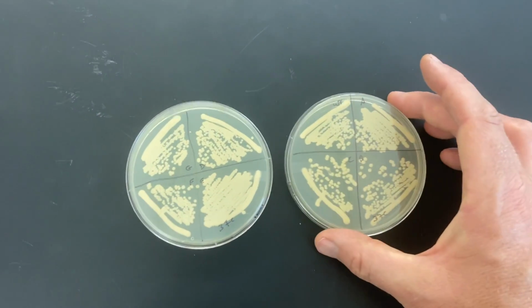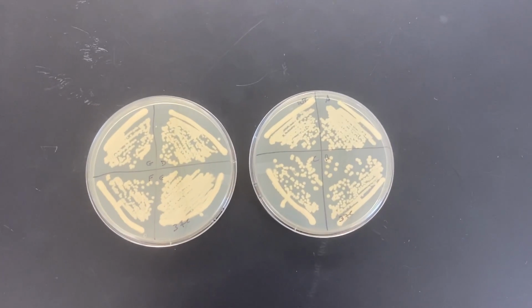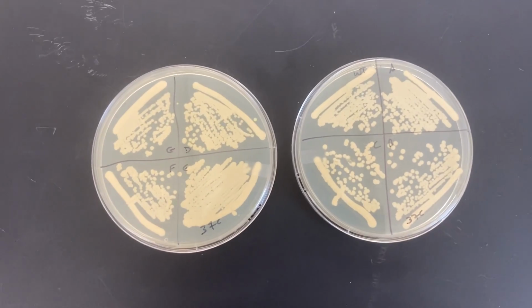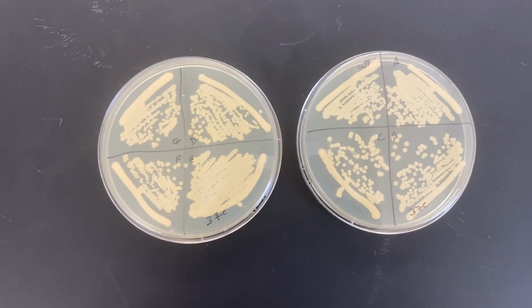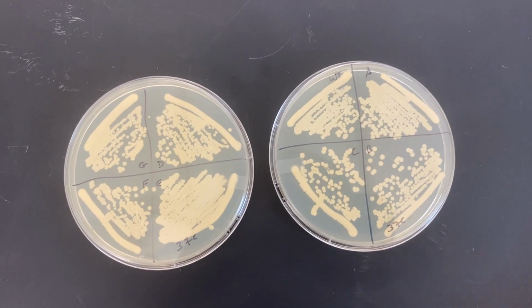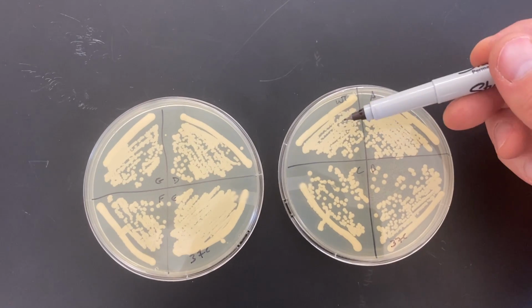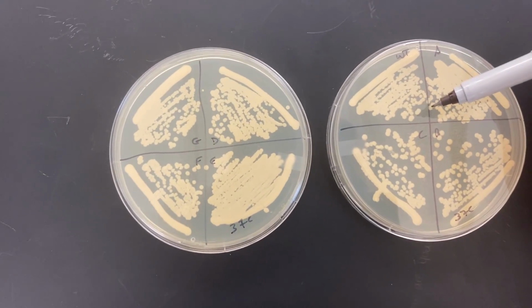So starting off with the temperature sensitivity for this one, if you remember, we did the streaking. So we streaked the cells trying to get individual colonies. These grew up a little bit more because they were at that high temperature. Probably gave them a little bit longer to grow than maybe I should have. Again, we're going to compare the sizes of the colonies. So over here we have the wild type, and those colonies are maybe on the small side.